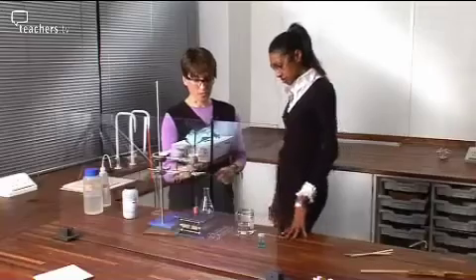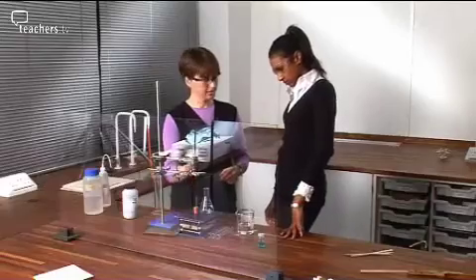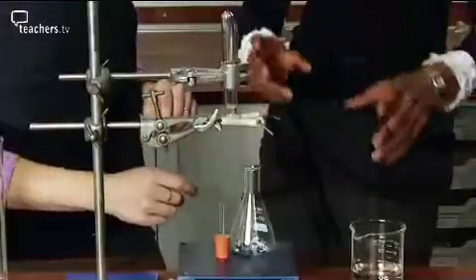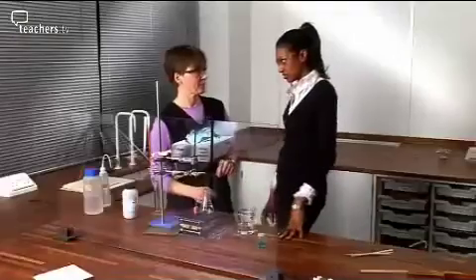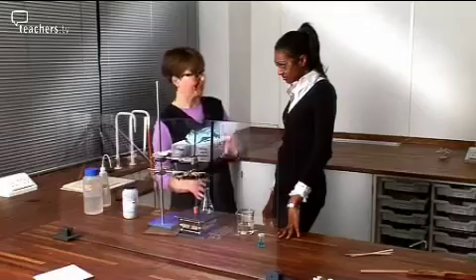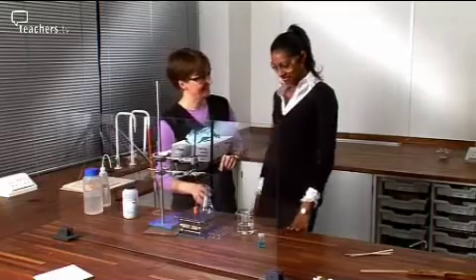Okay. What you should do is collect the hydrogen and then test it well away from where it's being generated. Because hydrogen and oxygen gives you an explosive mixture. But what we're going to do here is actually test it just above where it's being generated. Oh, okay. So the same vicinity. Yeah. Which is where the problem lies. Yeah, okay. And that's what's gone wrong before. So I think for this one, I'm going to ask you to step out, and I'm going to ask Bob to come in and give me a hand. I shall retire to a safe place.